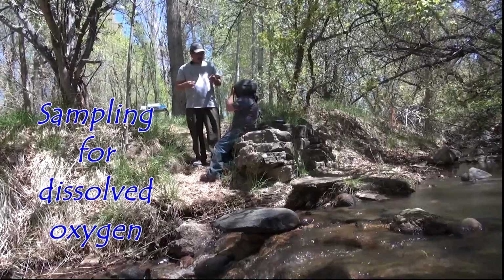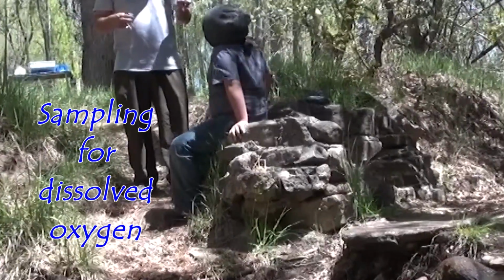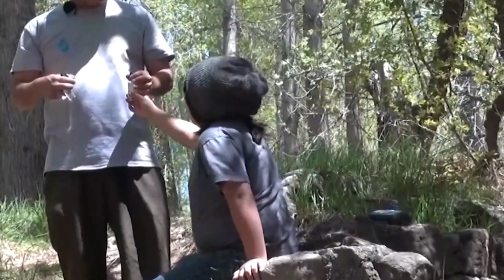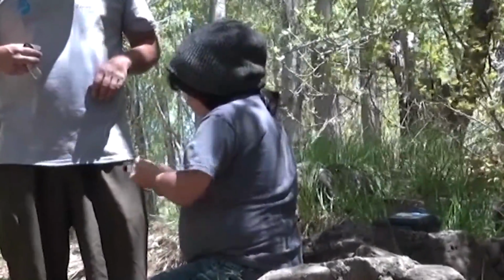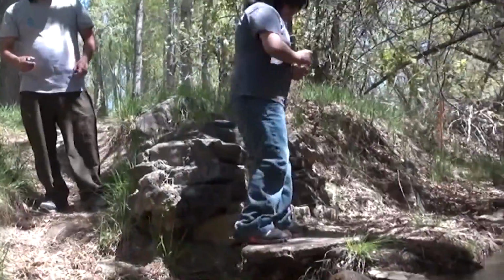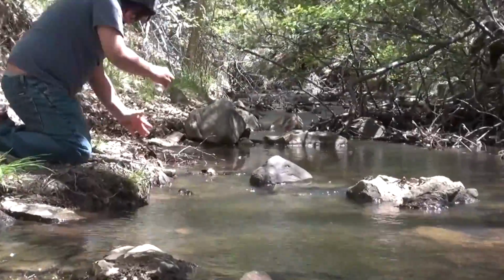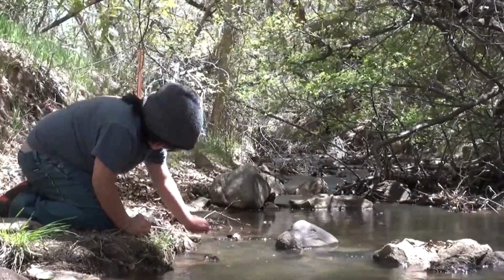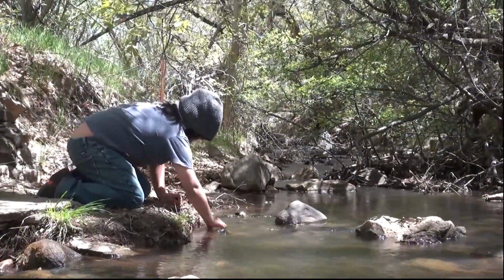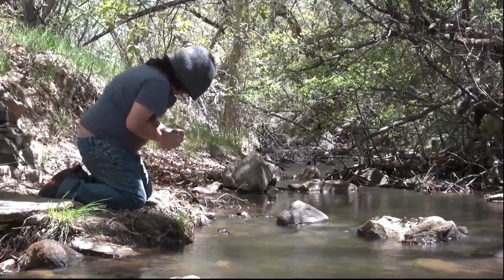Okay, Tommy, the next test that we're going to do is dissolved oxygen. One of the most important things about this test is to make sure that we fill this up without any air bubbles. Do you know how we do that? Yeah, we just dip it underwater. You fill it up all the way underwater and cap it when it's under the water, but make sure to rinse it twice before you fill it up, okay? Testing for dissolved oxygen is one of the hardest tests to perform to make sure that you collect the sample without any air bubbles in there.